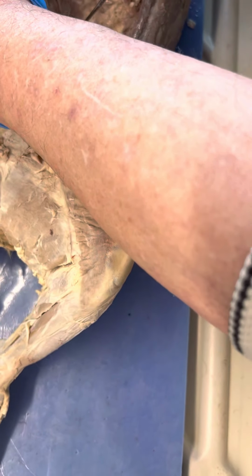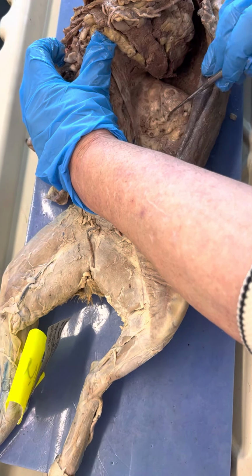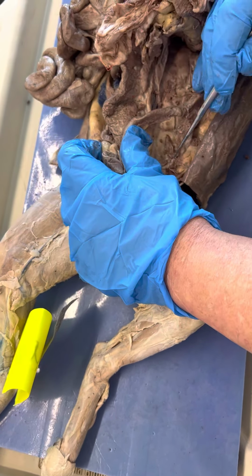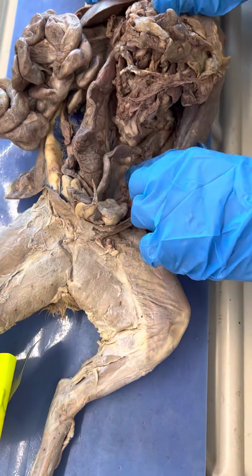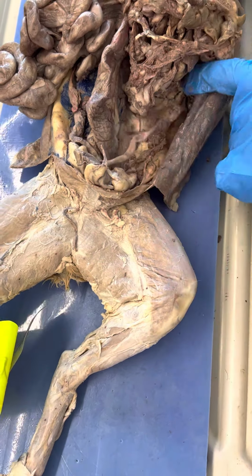And I'm not going to clean it out. See, all that fat would have to come off. And you would see a white tube that goes down from the kidney, and I could actually trace it right down to the bladder. That is a fair question. So you might want to look. I think it's a reasonable question. You might want to look at a cat. Somebody could really clean them out, because somebody doing the lab test could sit here and clean this out. But you would see it.